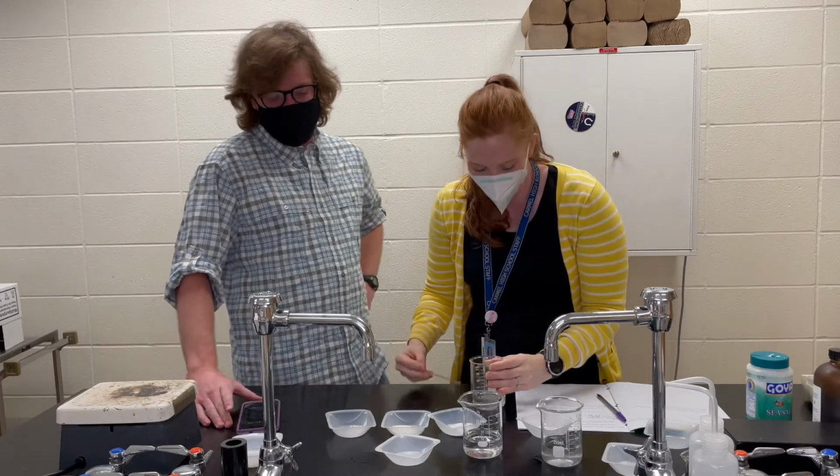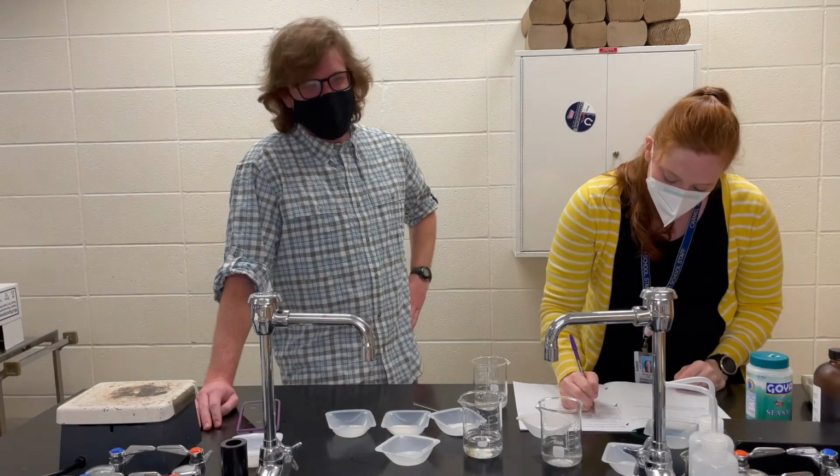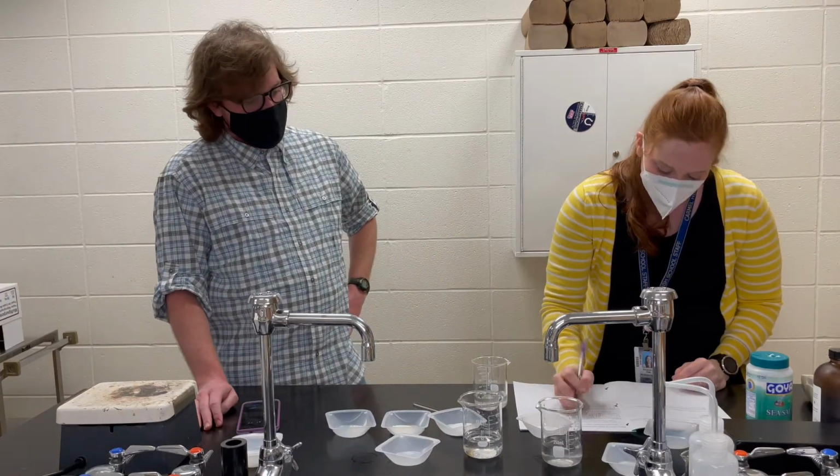That puts us at 2 minutes 41.7 seconds. Oh my gosh. Oh, okay, we got it.